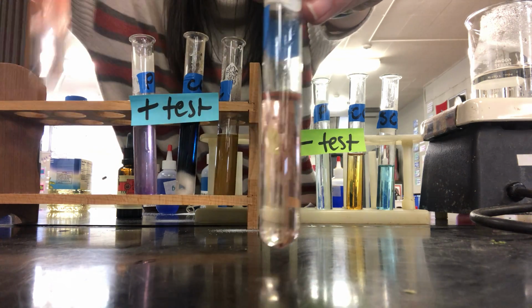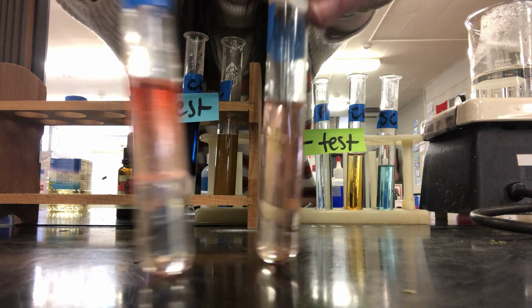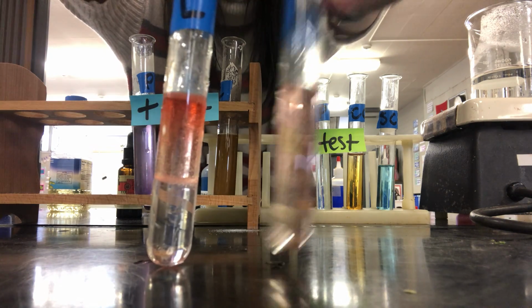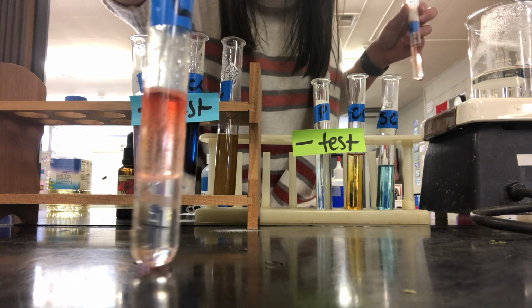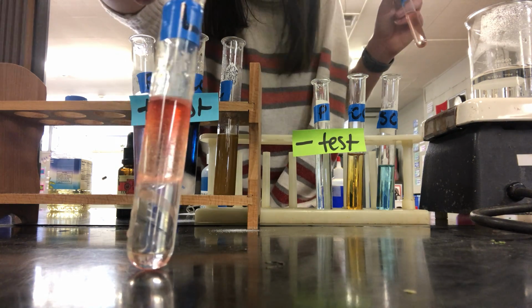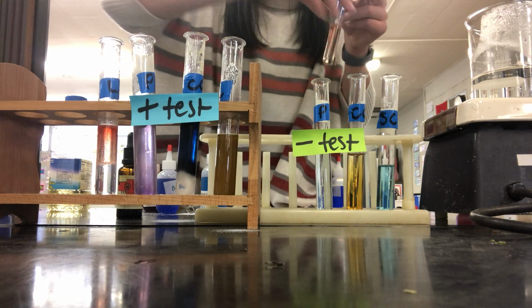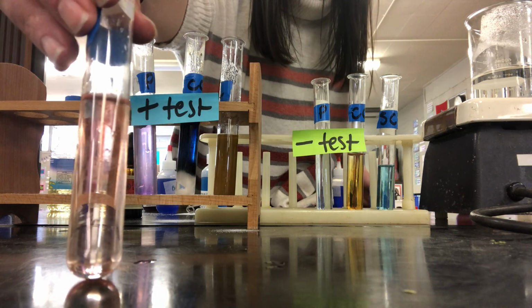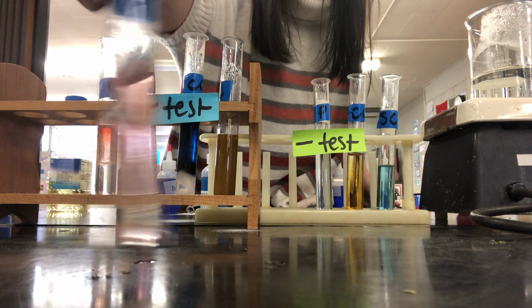And this one also looks red, my positive test. Now the difference is my positive test has a red ring that forms at the top. So that's what I want you to write for positive test. Red ring forms at the top, or like a fatty ring forms at the top. Now with my negative group, meaning there's no lipids in here, there's no fatty ring at the top. It just kind of turns a light red color. But basically you're just looking for whether there's a ring at the top or not, and it'll be nice and clear.